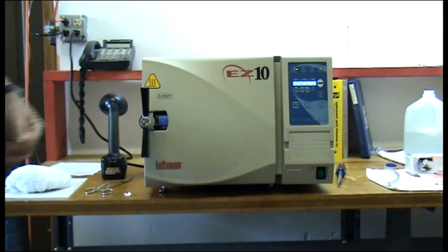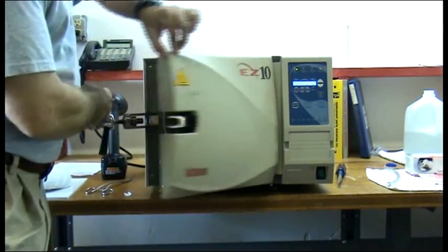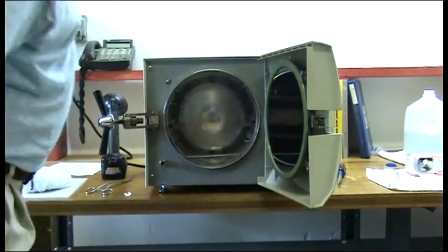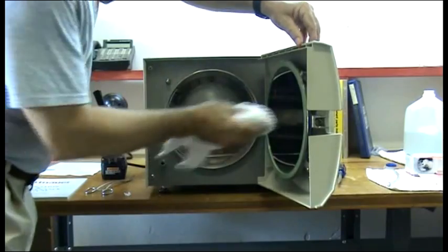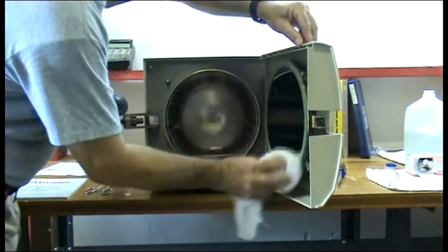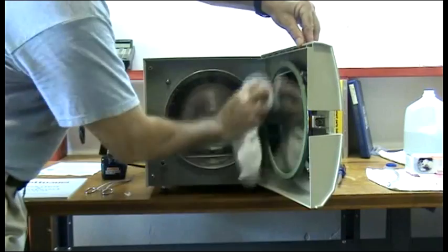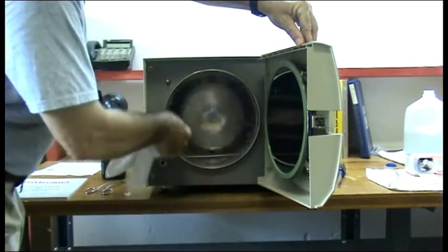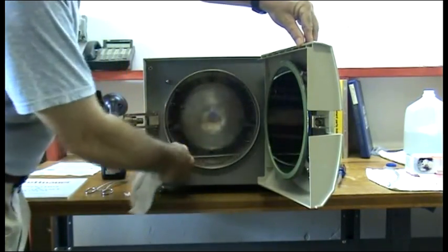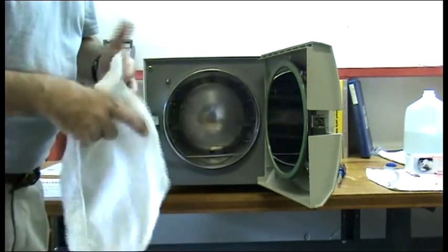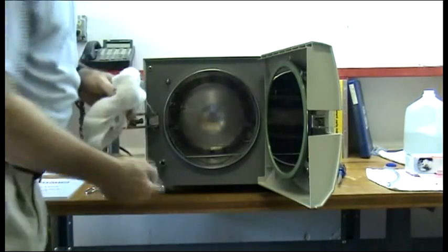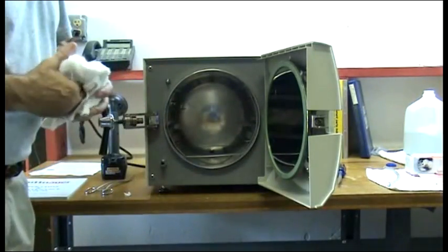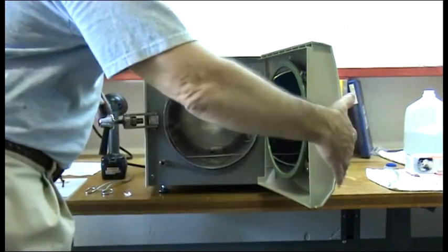It is recommended weekly that the gasket sealing the chamber be wiped. This is best done at cleaning. Take a damp rag or sponge and clean off the edge of the gasket as well as the edge of the chamber. This is the first step if you have a chamber leak, which would be evident by a little water gathering at the bottom of the door.